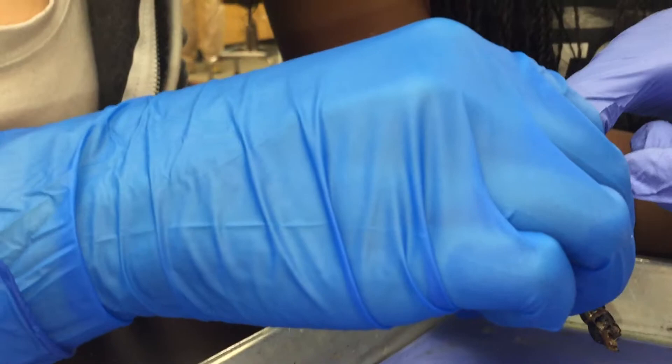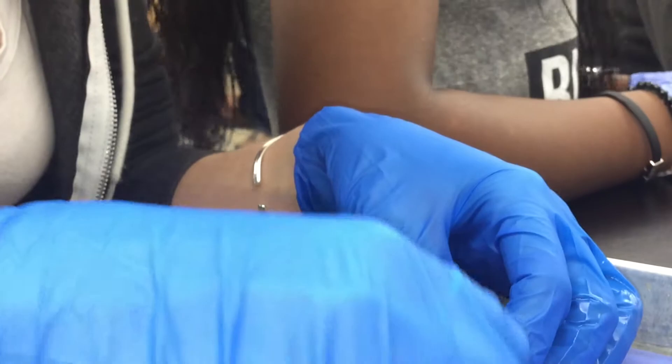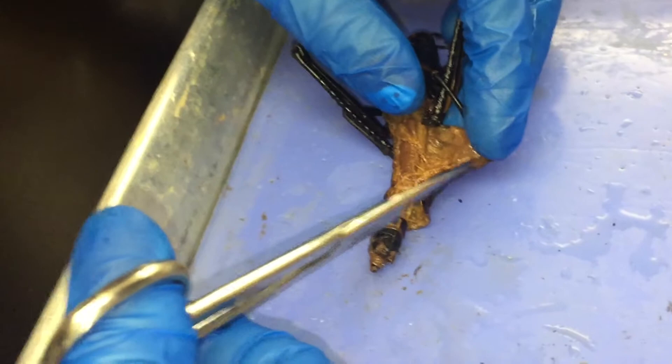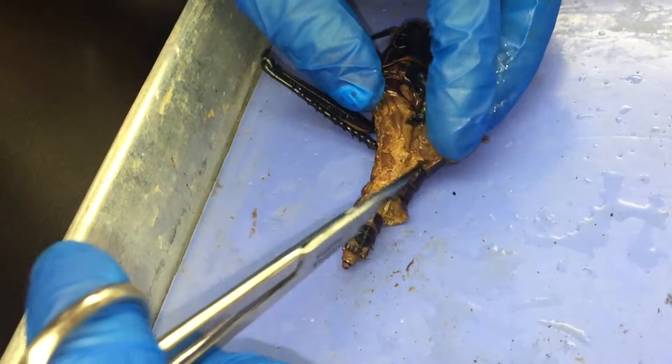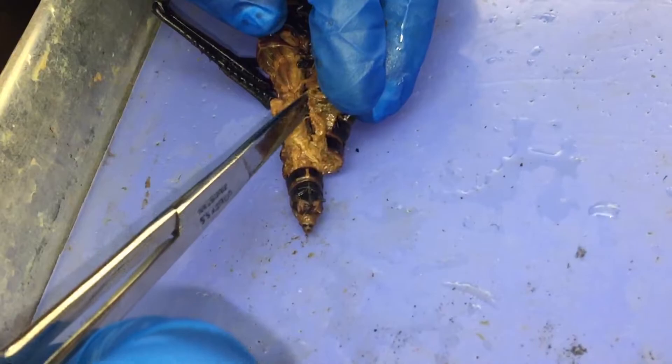The little guy's all upset, never got any respect, and now he's 19 feet tall with tentacles. It does have some meat on it — you could totally eat these. Please don't say that right now. These smell really bad on the inside. Like that TED Talk about 20 kilograms of grasshopper meat.